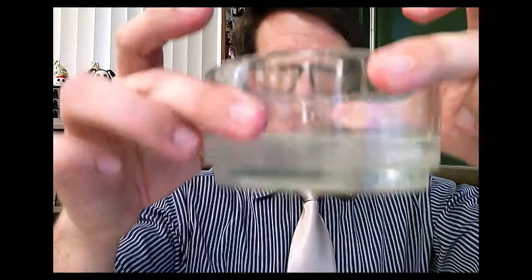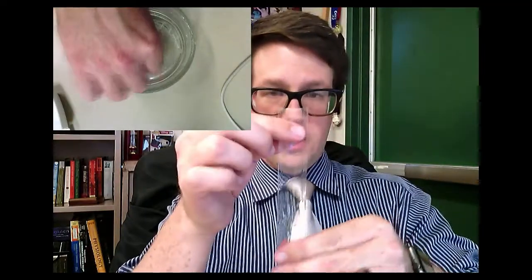It's actually a tube even though you can't tell, so what we have to do is make it usable. Once you have it as a tube and can open it up, you can tie it off using dental floss and actually make a bag out of it. I've let them sit in a little container of water for two minutes or so.